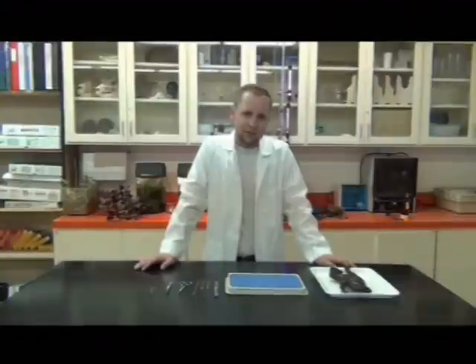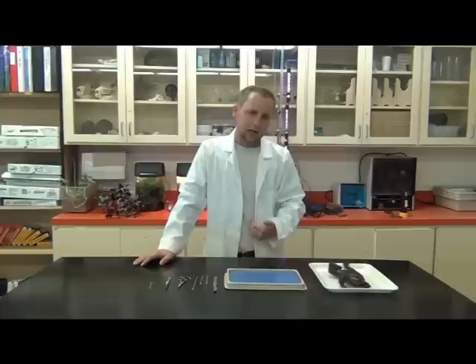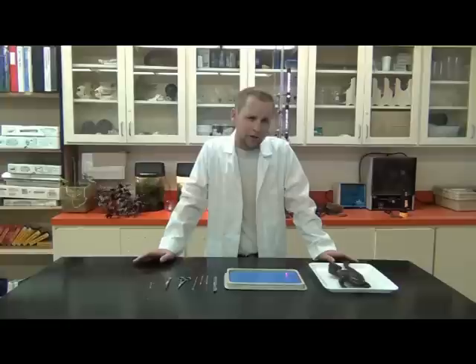Today we're going to go over a very basic dissection of a bullfrog. We'll be looking at some of the external anatomy, opening up the mouth, and eventually cutting into the body cavity and identifying several of the organ systems. This will be an overview — a little bit of what to expect when you do this in junior high and high school, kind of an intro to dissections.